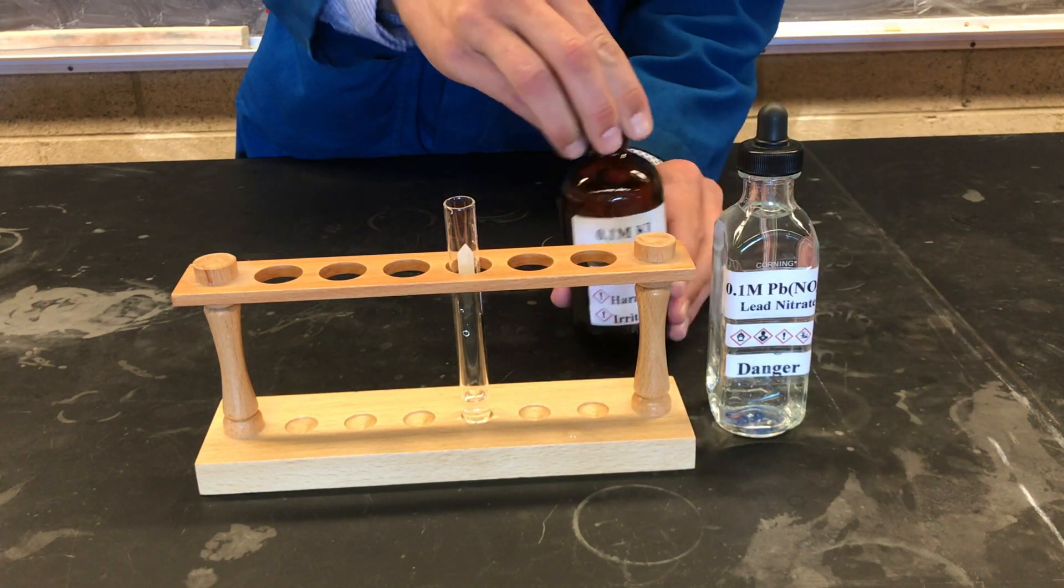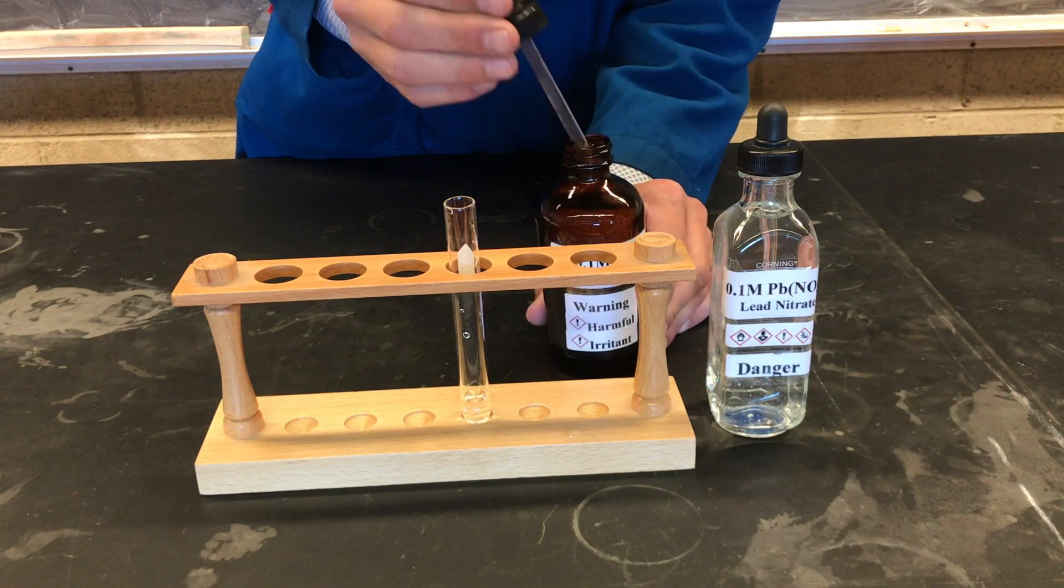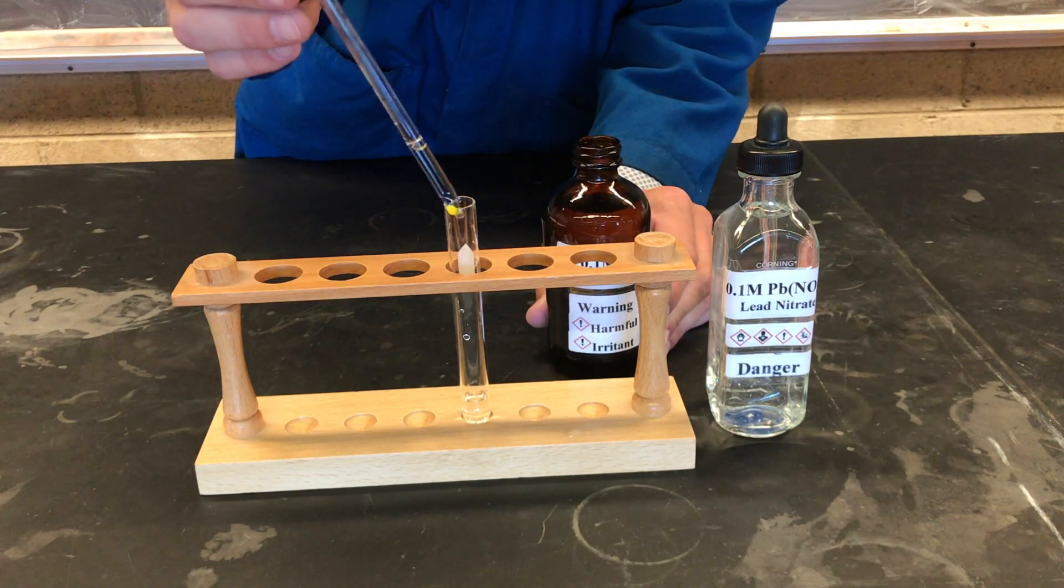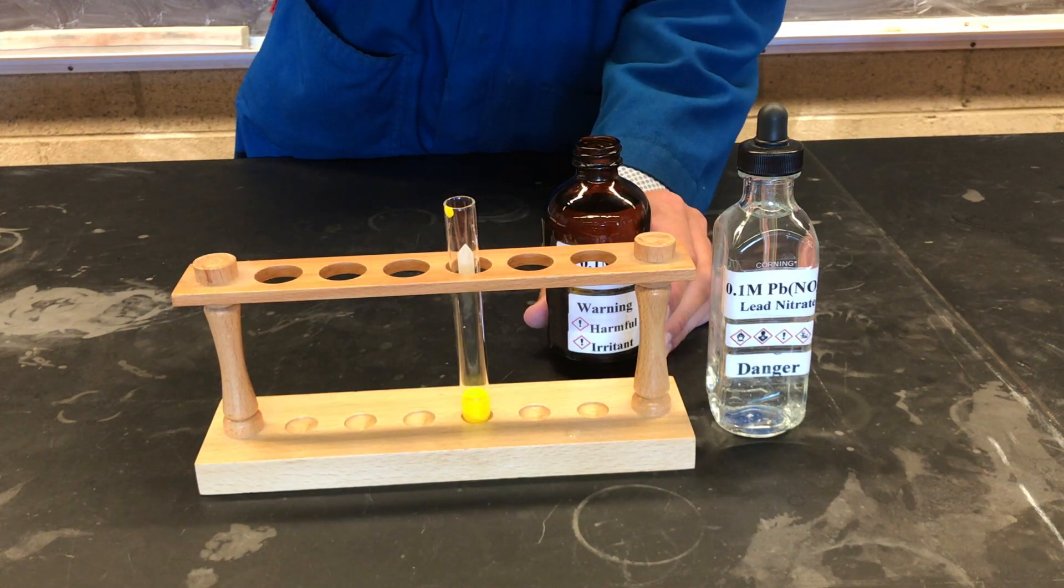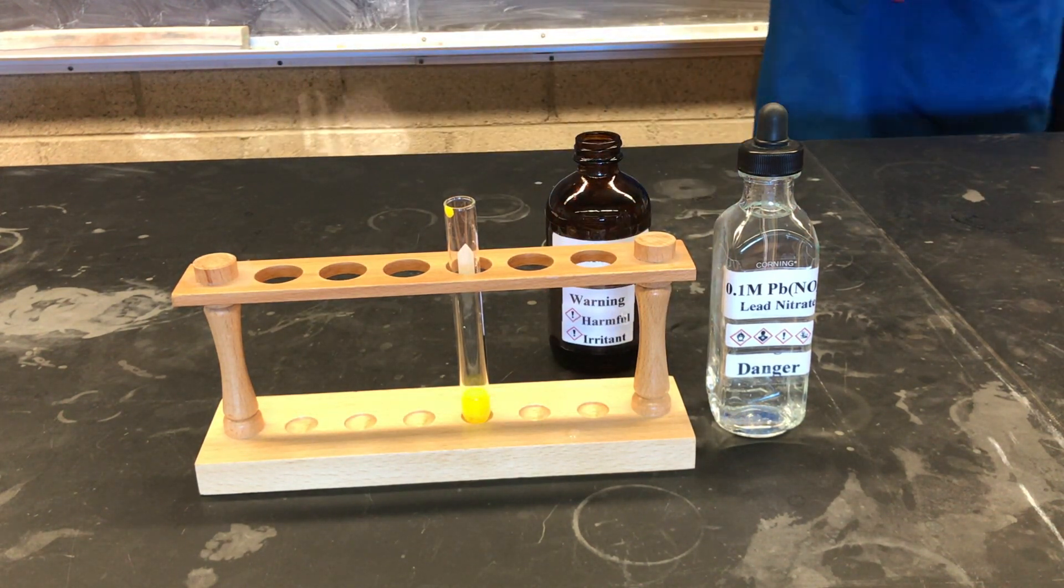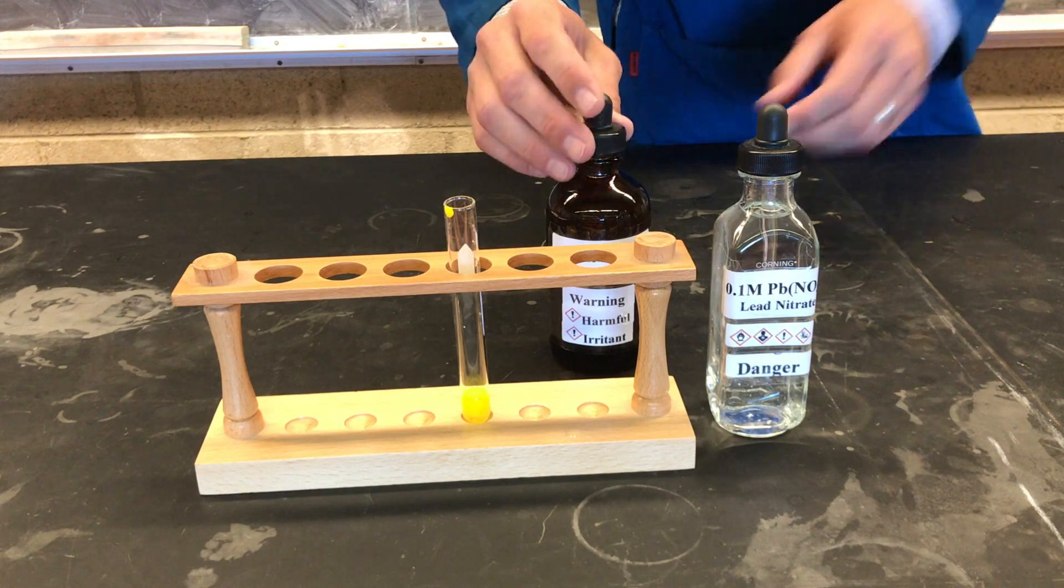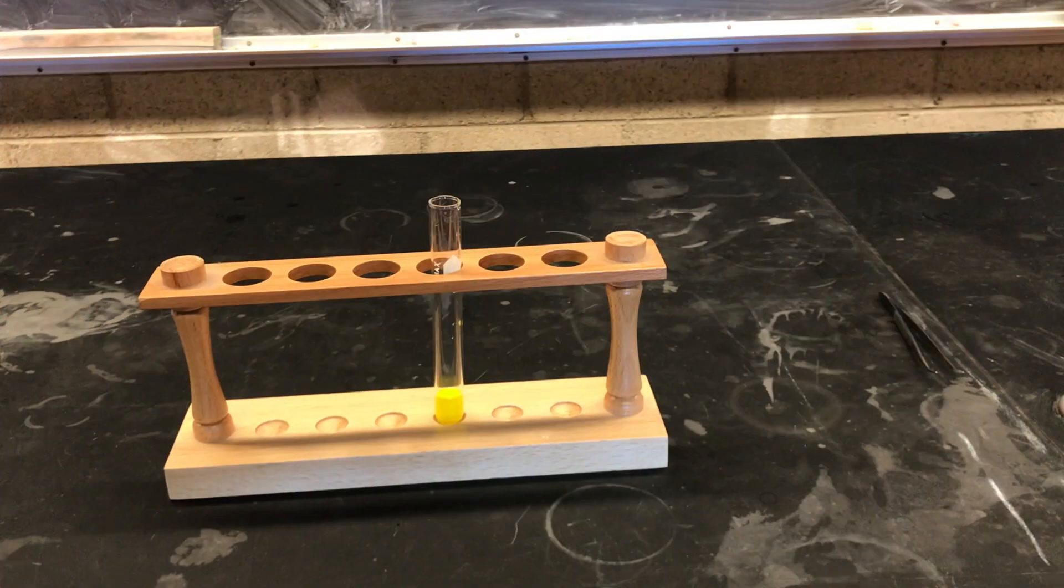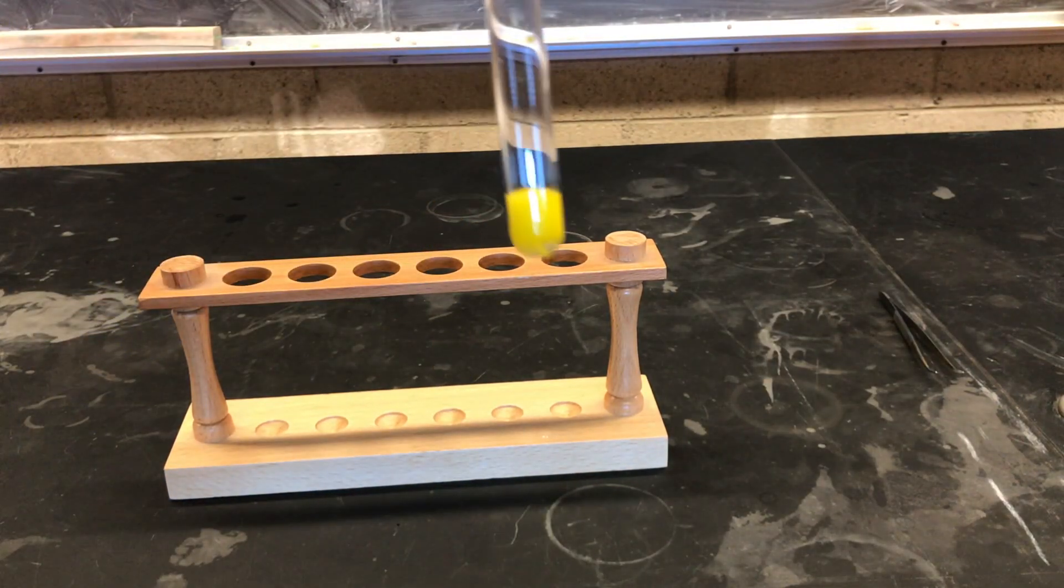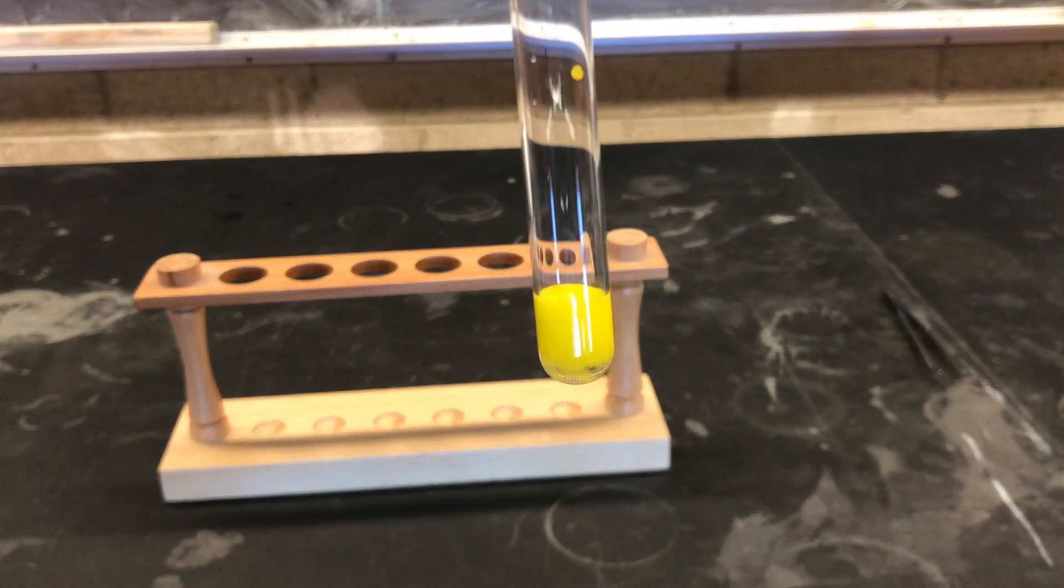And then I will add about 2 drops. And we can make our observations. Always cap the reagent bottles. Properly dispose of waste in the labeled container and clean glassware.